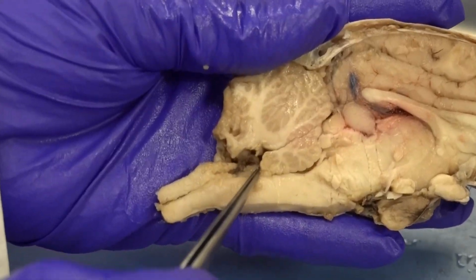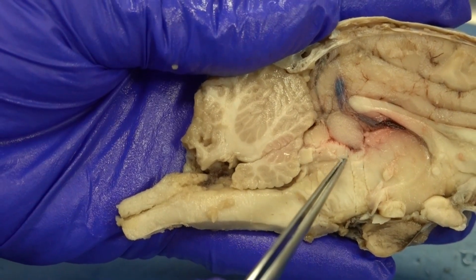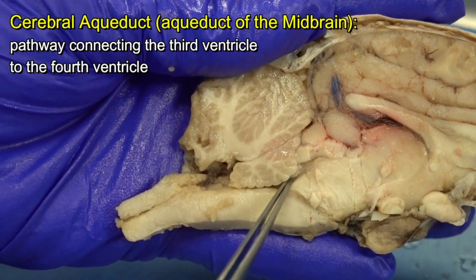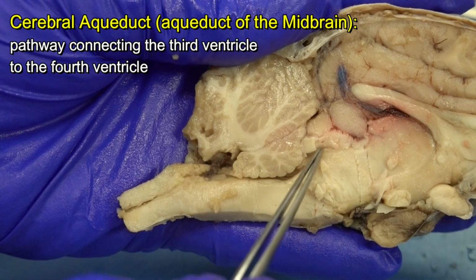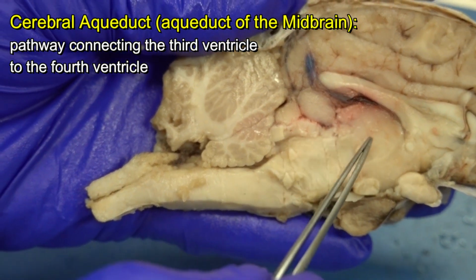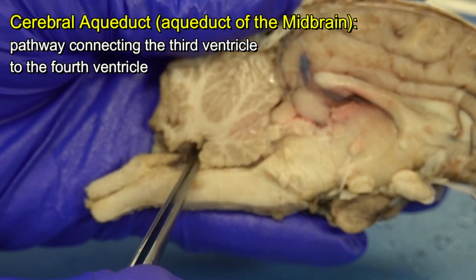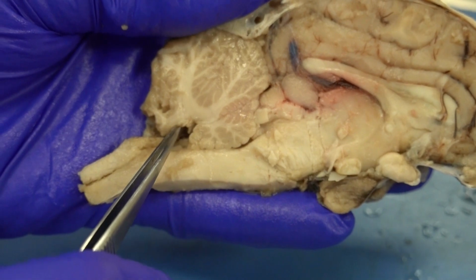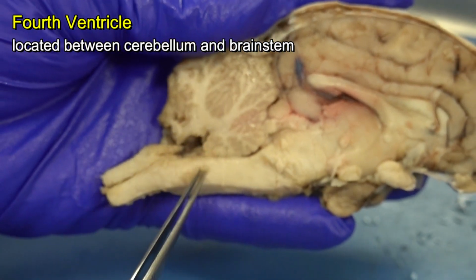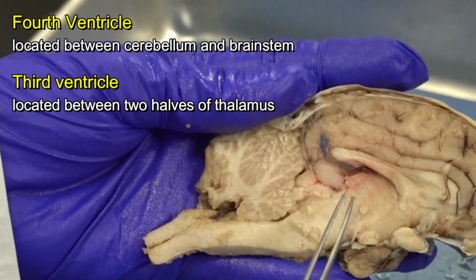From the fourth ventricle, we have a long pathway. I'm walking through this pathway. This pathway is called the cerebral aqueduct or aqueduct of the midbrain. This pathway is connecting the third ventricle that is supposed to be here to the fourth ventricle. As I mentioned, the fourth ventricle is between the cerebellum and brainstem. The third ventricle is between the two sides of the thalamus.